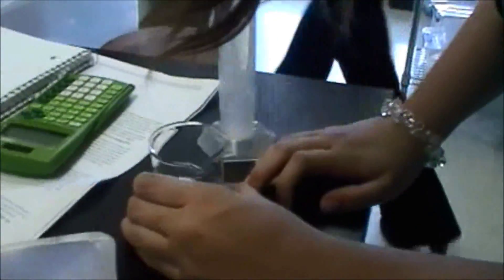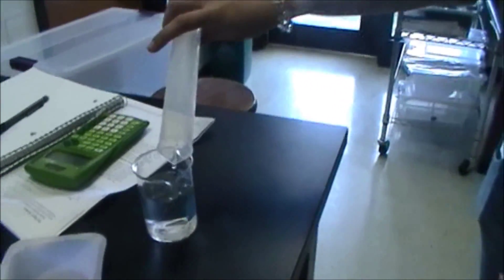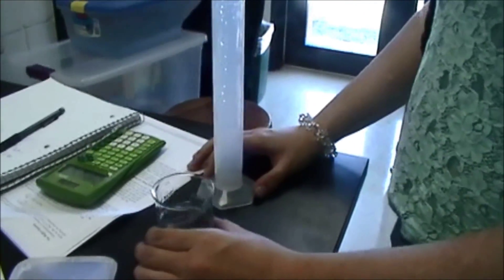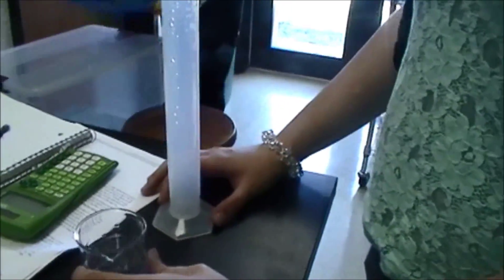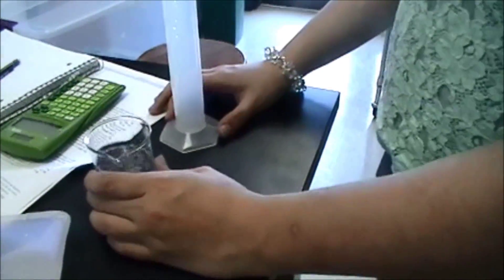Here Erica is making our buffer solution with ammonium hydroxide and ammonium chloride. Yep. Okay guys, here's some funnels, here's the main thing. Tell me what we're doing, Kalina.